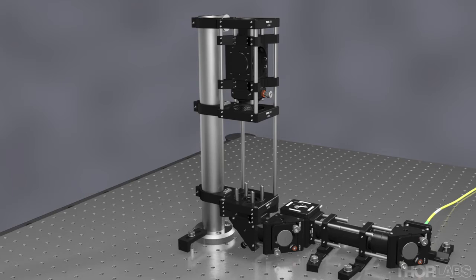Open up the irises and inspect the beam after each one using the laser viewing card. Make sure the beam is uniform and is not clipped. Once properly aligned, the laser should be turned off for the remainder of the installation.